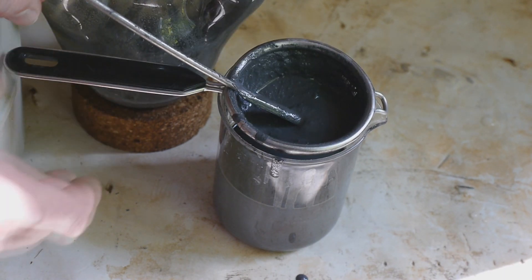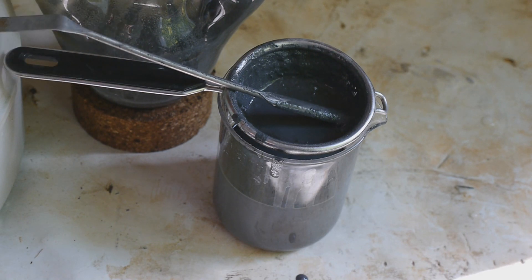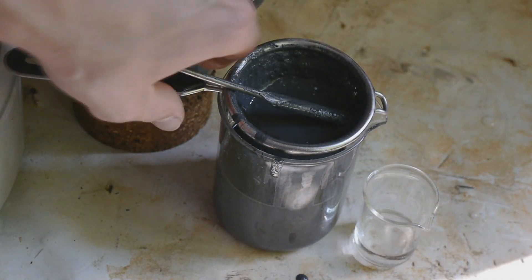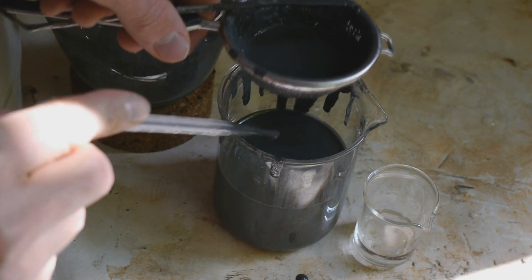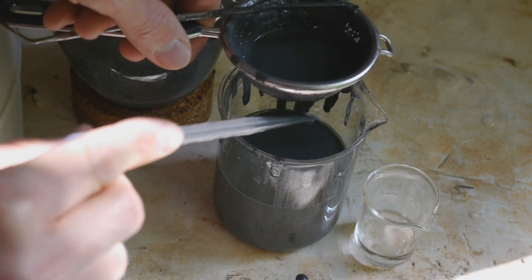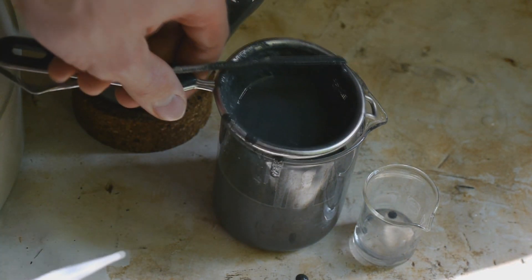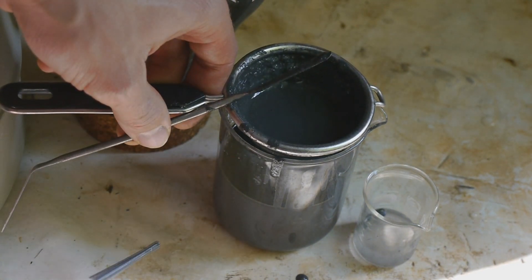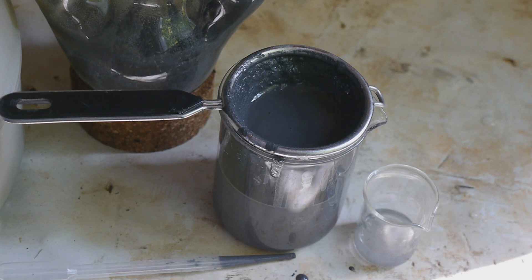So that's the stuff that's not going through the sieve. Might be sodium but it's definitely not coalesced enough for me to tell properly. And other than that I am not sure. This is definitely not looking like it's supposed to. Before I try to work this up any further, take a drop of that that went through the sieve and see if it fizzes if I drop it in some ethanol. Oh yeah it definitely does. Yeah so there is a lot of sodium in there. It's just finely divided which is bad. Probably have to filter this off somehow and then try to boil it in dioxane.